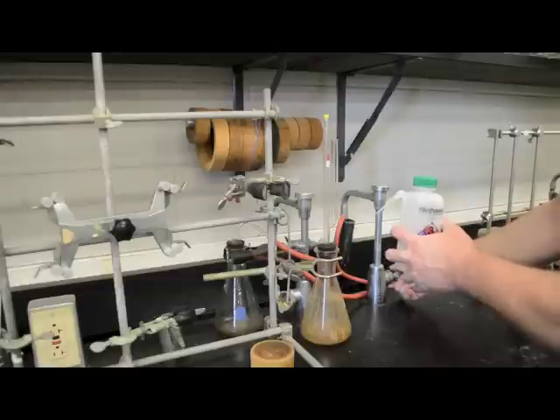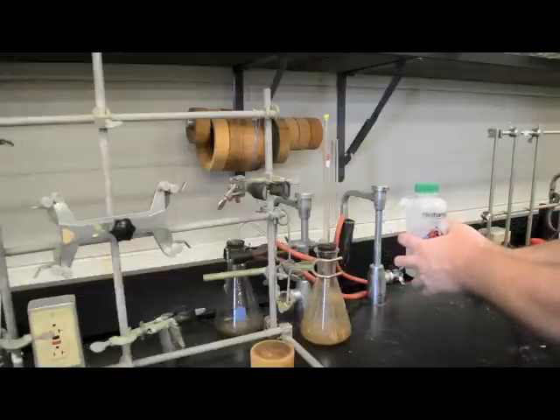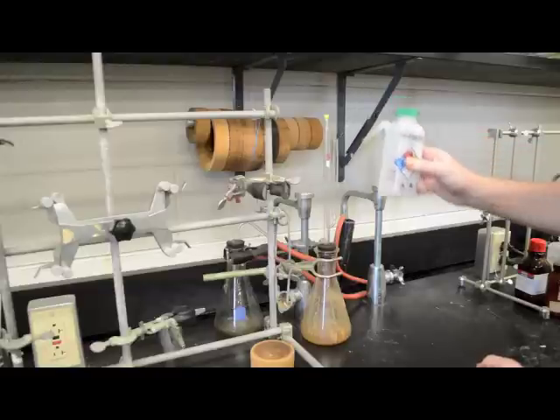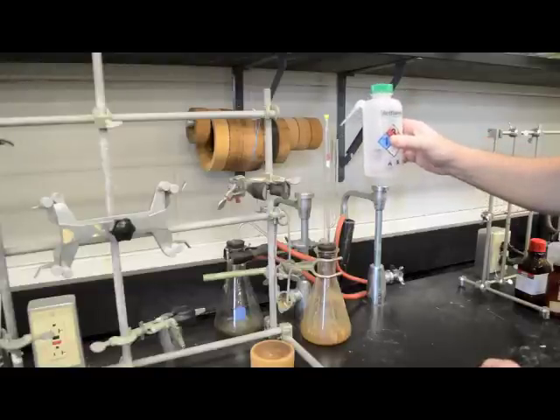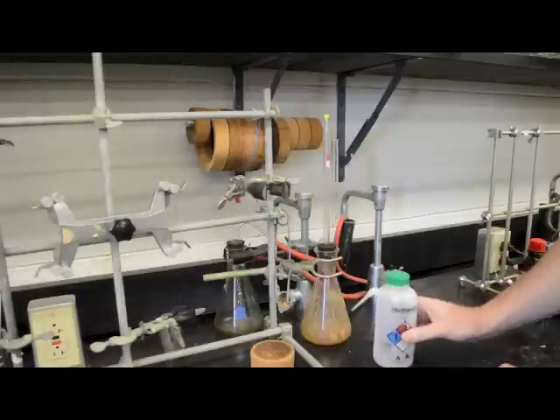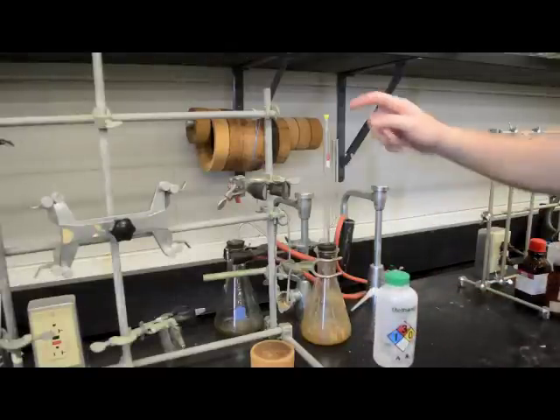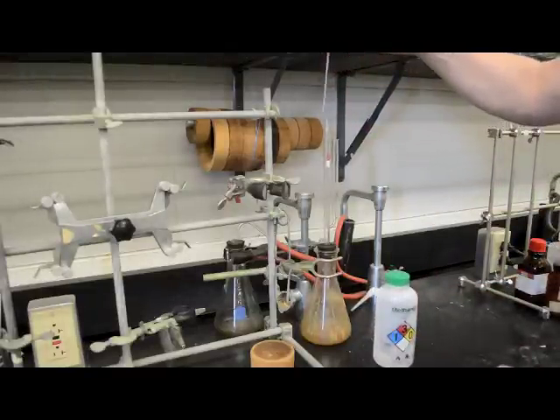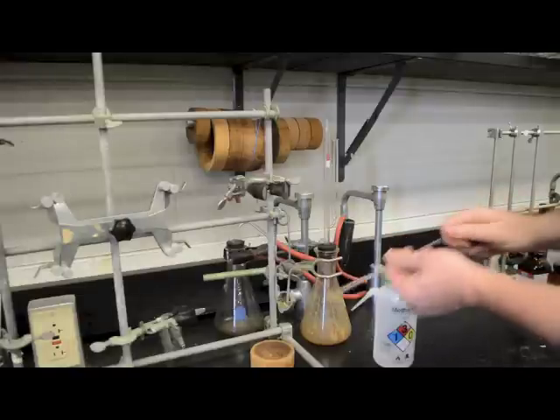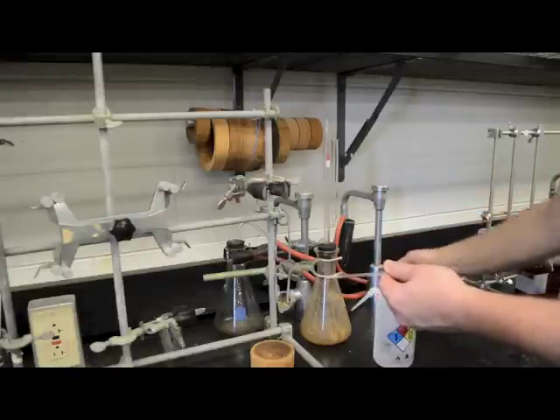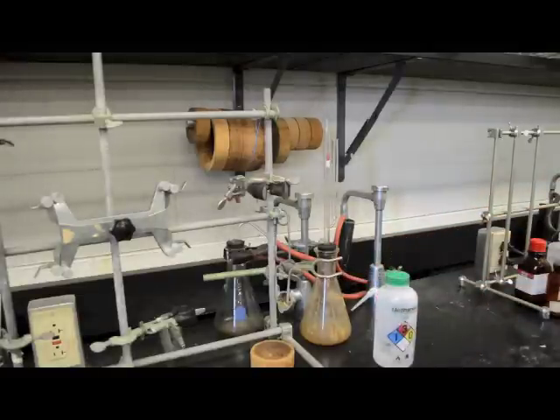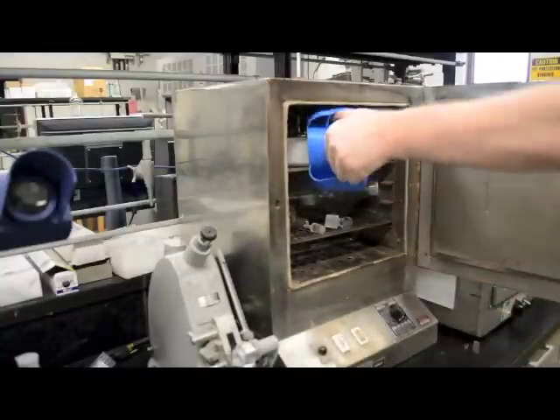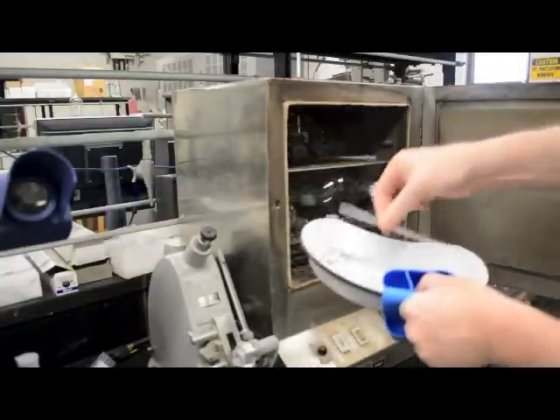Turn on the vacuum water and use methanol to rinse out the NMR tube. The vacuum should force the methanol up into the entirety of the tube. Leave the tube on the washer for a few seconds to remove the bulk of the methanol. Next, take the NMR tube out of the NMR tube washer, take the top off, turn off the vacuum water, and carefully put the NMR tube in the tray in the drying oven.